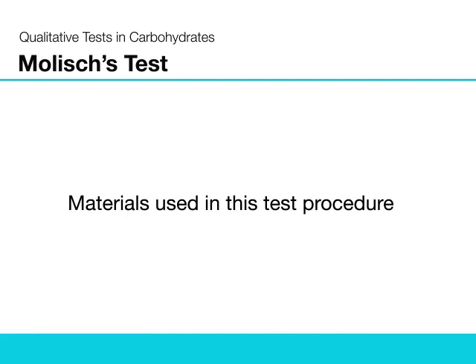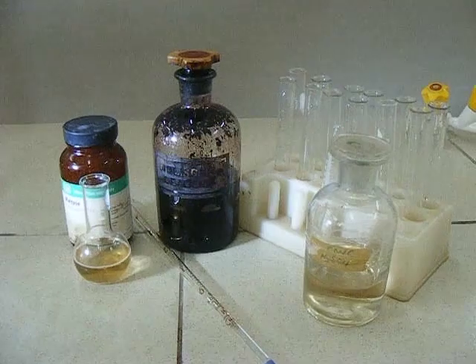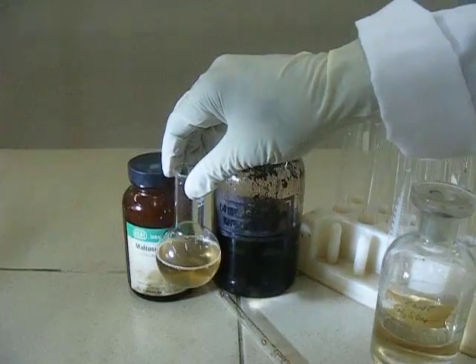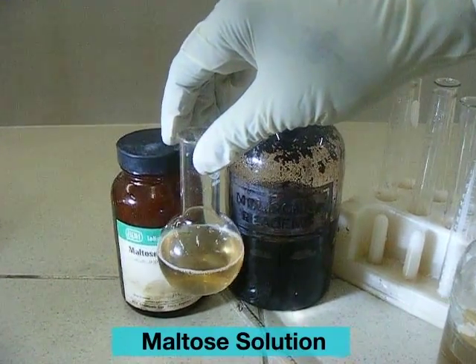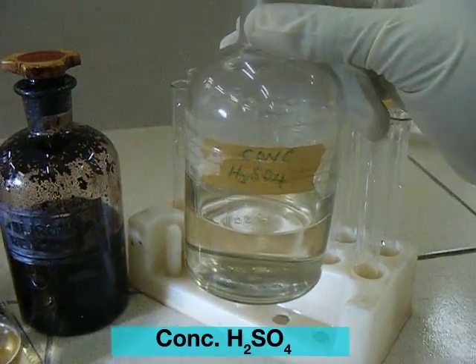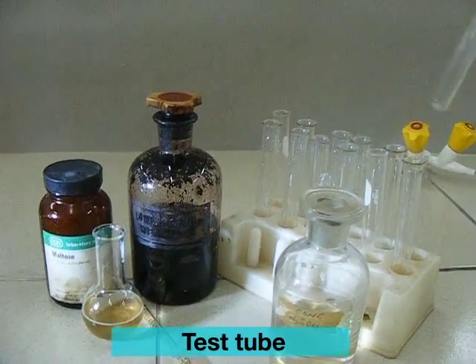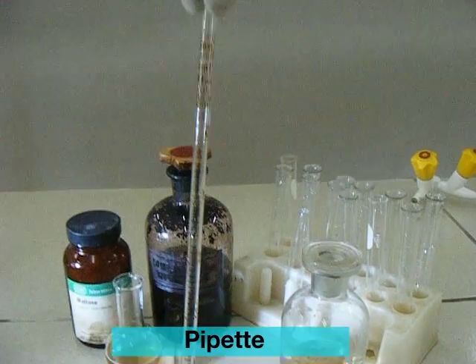Materials used in this test procedure: maltose solution, Molisch reagent, concentrated sulfuric acid, test tubes, a measuring cylinder, and a pipette.